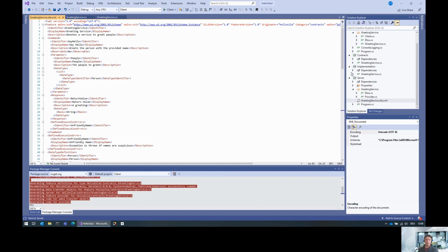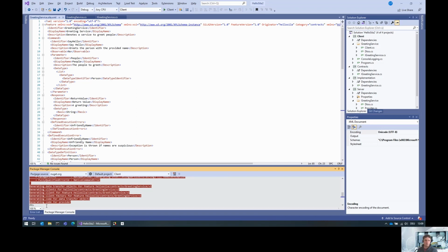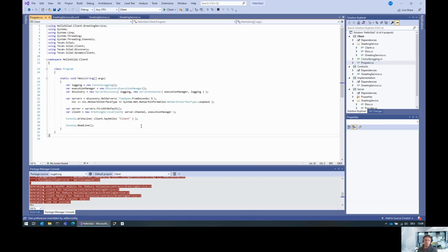Okay, cool. If we want to execute this, we also need to rerun the code generator for the client. Here again we have the path to the feature, which is this one, then the path to the client CS file. Here it is. Client. Boom. And if we do that, we of course get a compile error, because the client is no longer a collection of person.